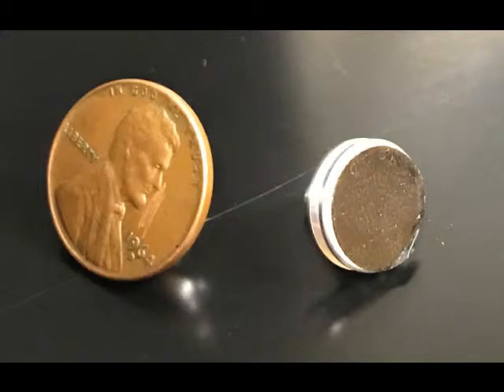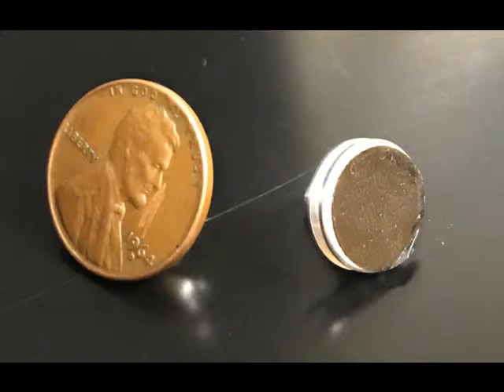The copper penny is over on the left. You can see, if you look by Lincoln's nose, where we've scraped away a little bit of the surface oxidation and deposits. You get oxygen forming with the copper on the surface, but you also get oils and things from your hands that form a hard tarnish on the surface. We want to see a little bit of the pure copper underneath.